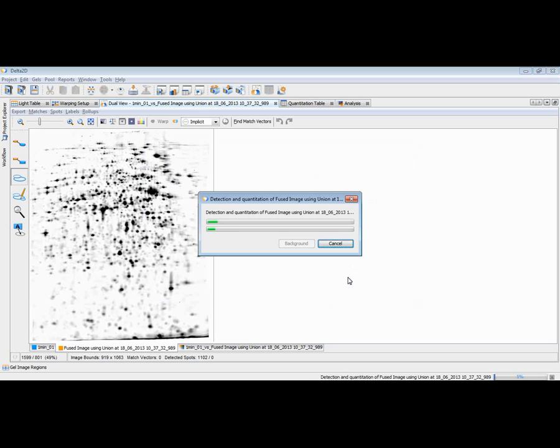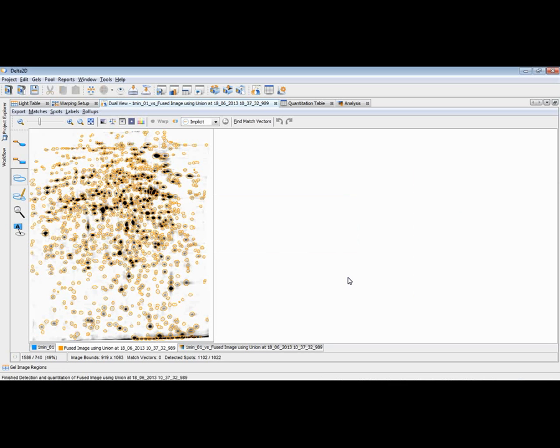I press OK, and then the spot detection is done on my fused image only. As you can see here, there is a number of spots detected. 1,102 spots have been detected. And of course, the image includes areas where we don't want to use the spots. Delta2D does not know which area is of interest and which not. So we can remove those spots from areas that we are not interested in manually. I can just drag a rectangle with the activated spot selection tool, select all the spots, and then press the delete key on my keyboard or right click on one of them and press cancel spots. Then they are hidden automatically and ignored by the further analysis.